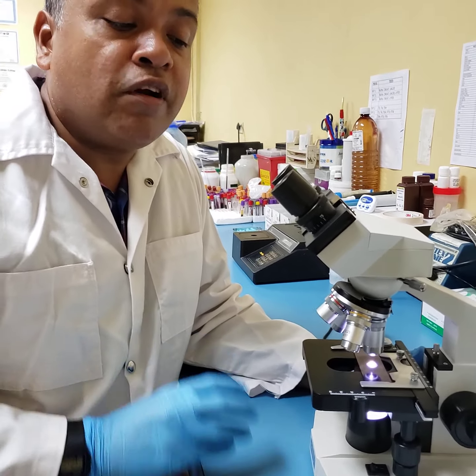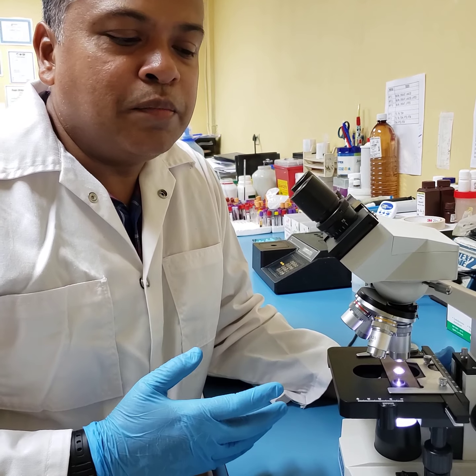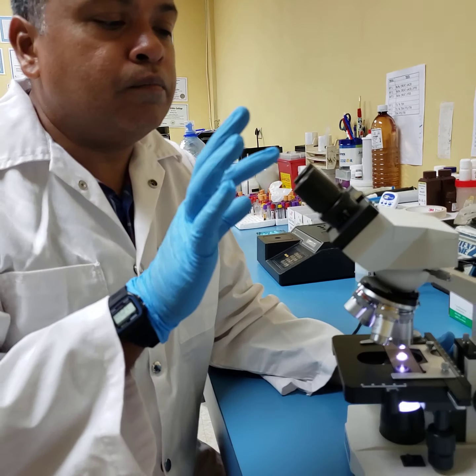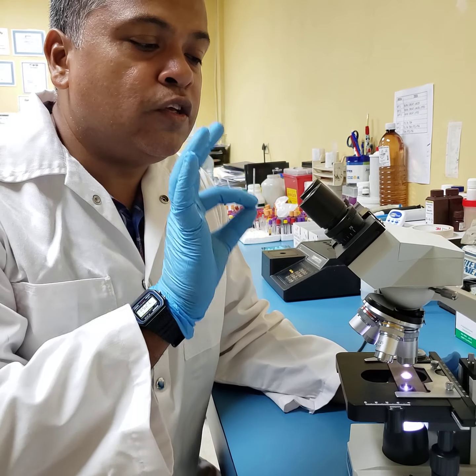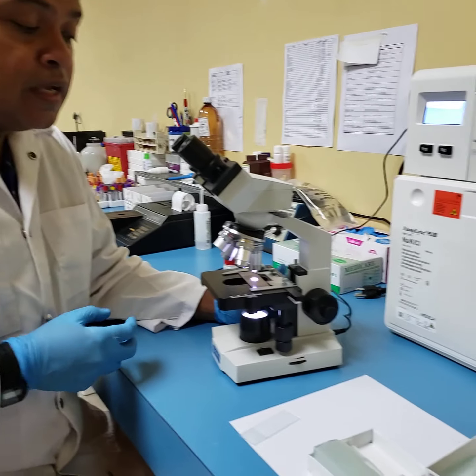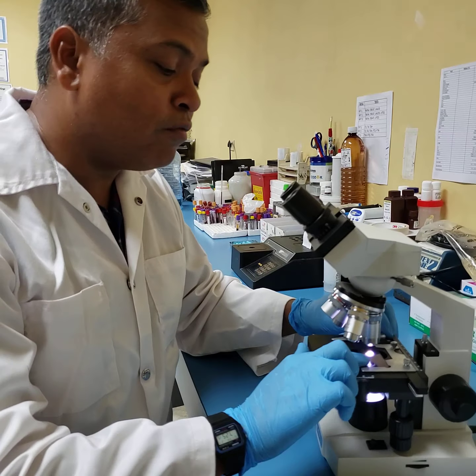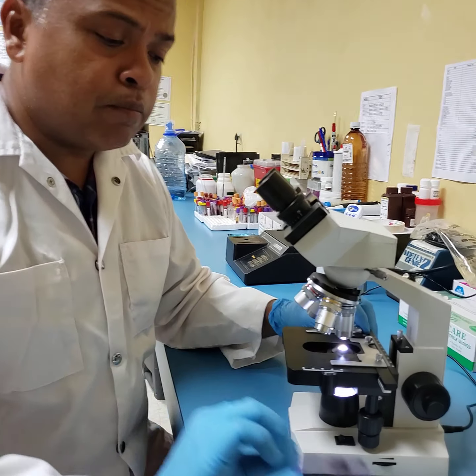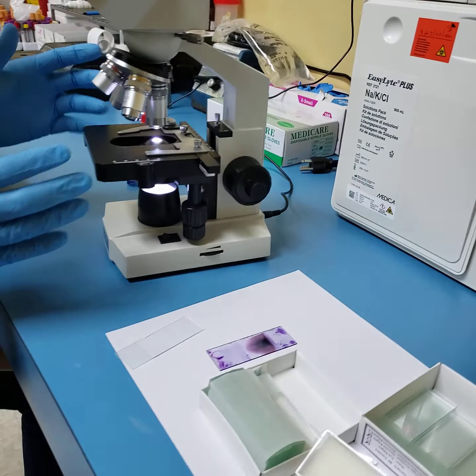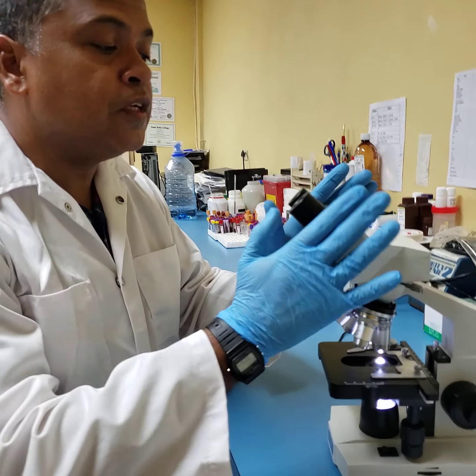So that is one very important tool. Apart from that, general housekeeping dictates that safe wipes are used in terms of lens wipes, and there's a lens cleaning solution. It is important that we sanitize and we clean our microscope at the end of every work session, and that microscopes are covered, powered off, oil is removed with lens paper, etc., so that we finish off and clean up our business.